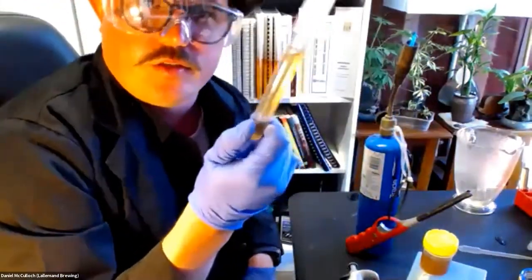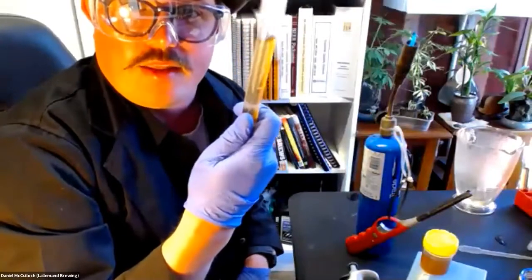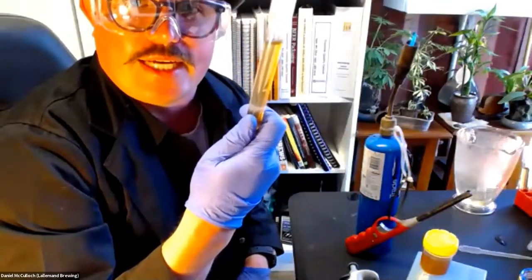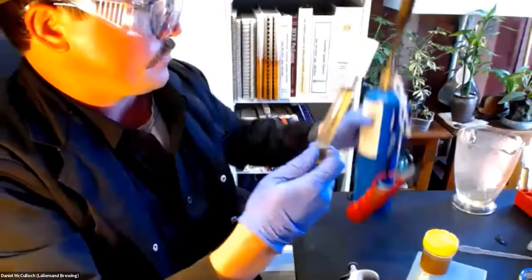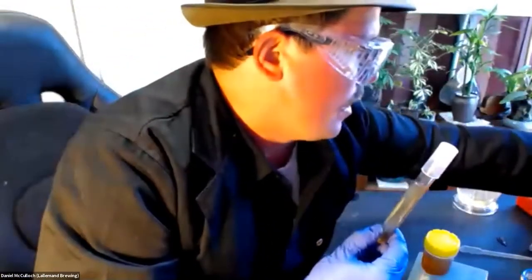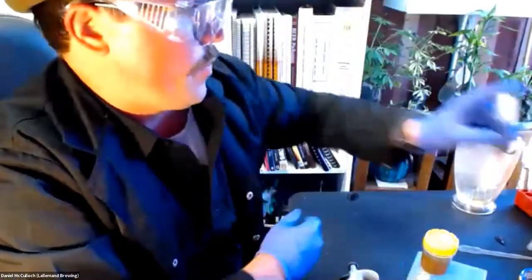And that's as simple as it is to inoculate, and then I'm going to put that in the incubator and leave it for 14 days, and check each day. I'll show you some examples that I prepared earlier.